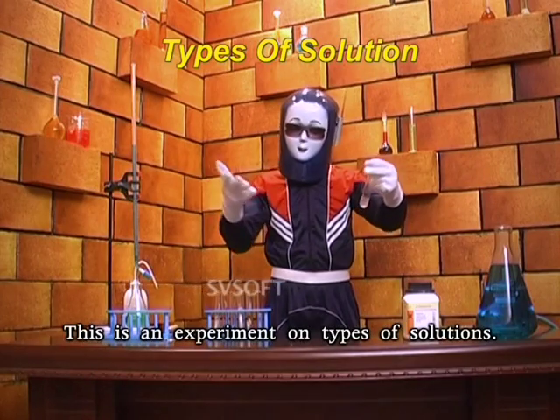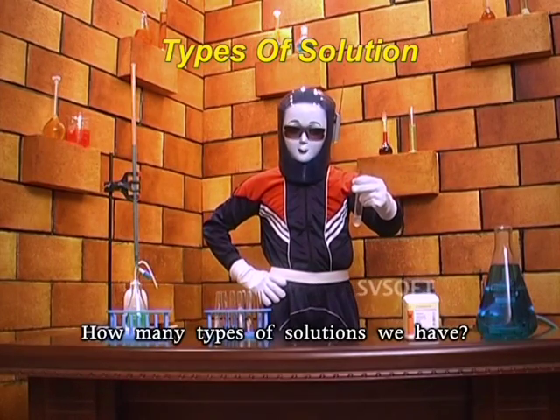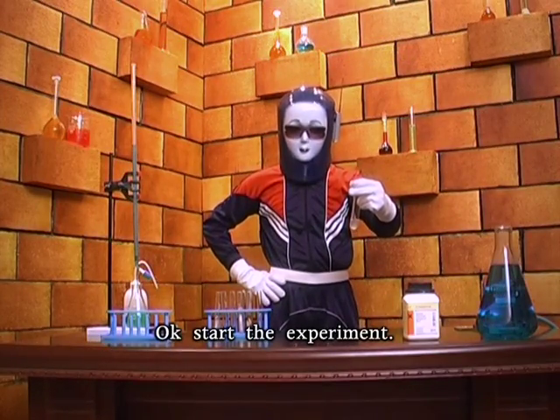This is an experiment on types of solutions. Types of solutions? How many types of solutions we have? That's what I'm explaining here. Okay, start the experiment.